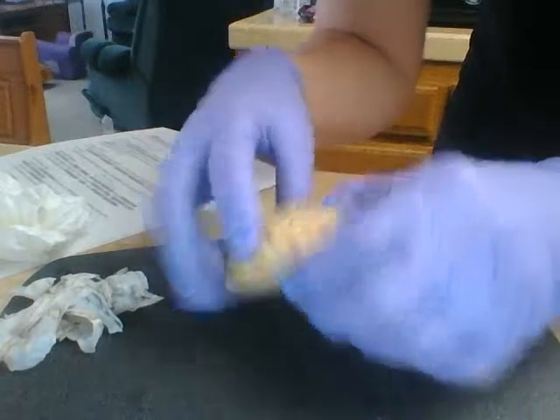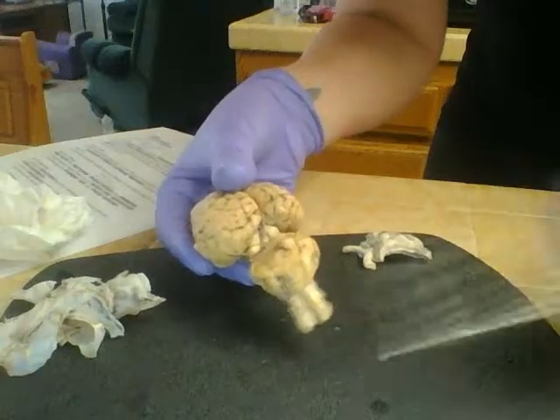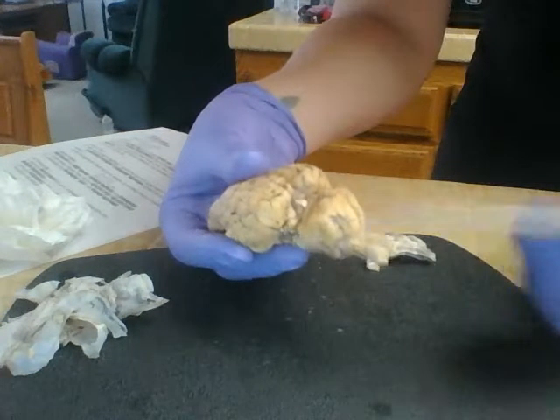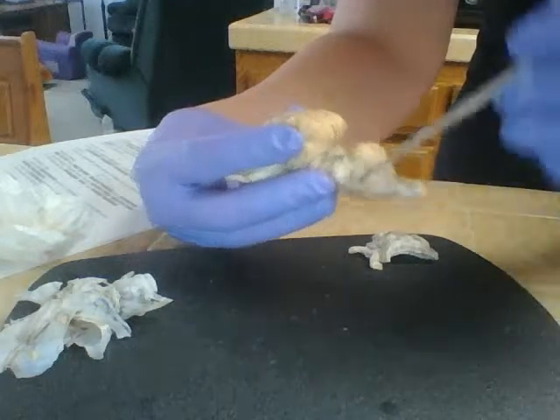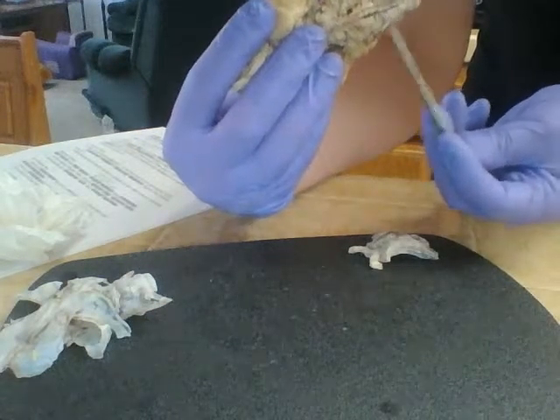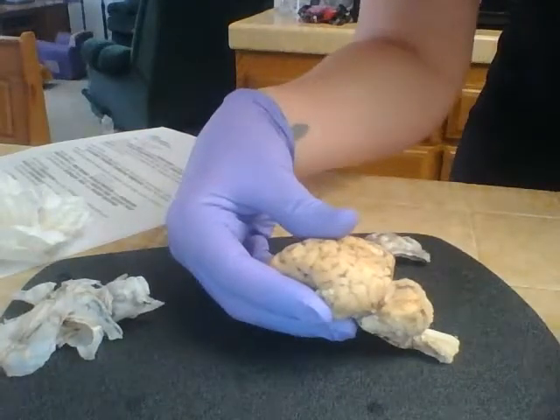Okay, so we're going to move down to the back of the brain here. So again, we come back here to the posterior portion where you see the occipital lobes. This little guy back here is our cerebellum, kind of like our little mini brain. So we have the body of the cerebellum here, the pons extends off this, kind of bulges here, and then we have the medulla oblongata that comes in a little bit farther here and branches off, and we can see that.